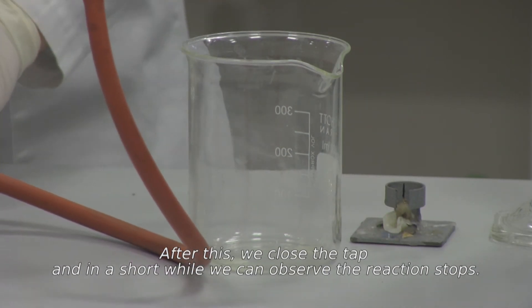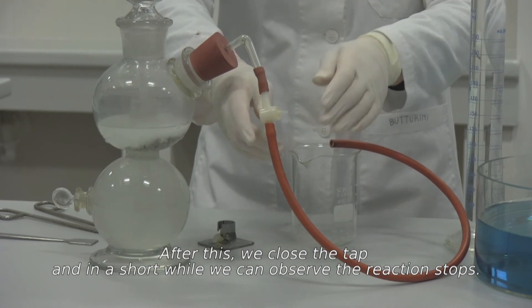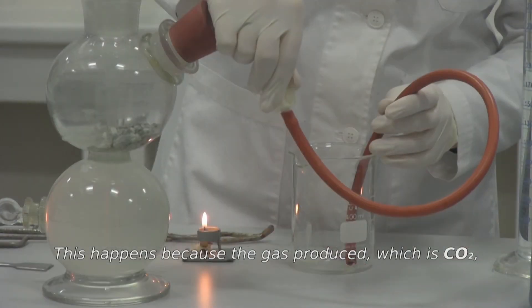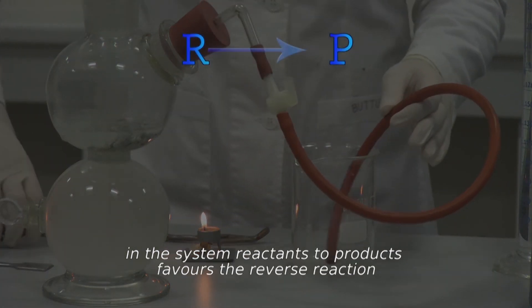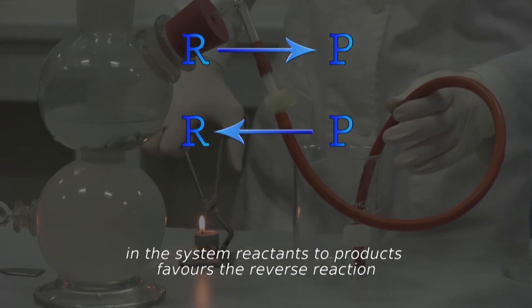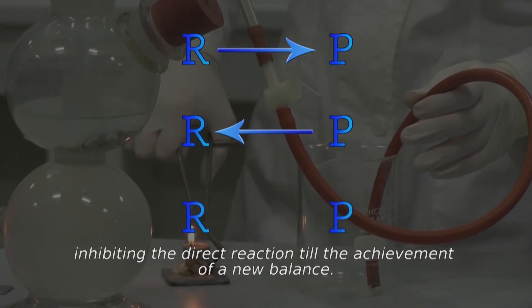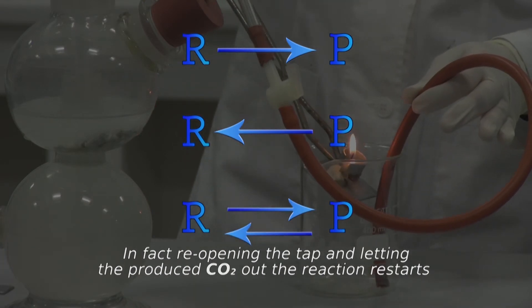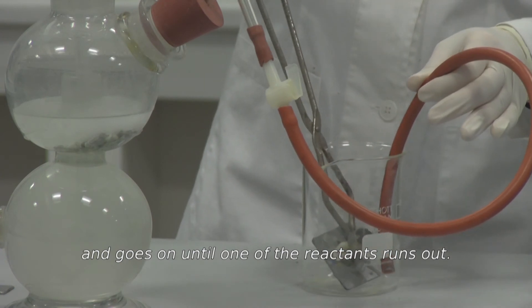After this, we close the tap and in a short while we can observe the reaction stops. Why does this happen? This happens because the gas produced — which is carbon dioxide — in the system reactants to products favours the reverse reaction, inhibiting the direct reaction till the achievement of the new balance. In fact, re-opening the tap and letting the produced CO₂ out, the reaction restarts and goes on until one of the reactants runs out.